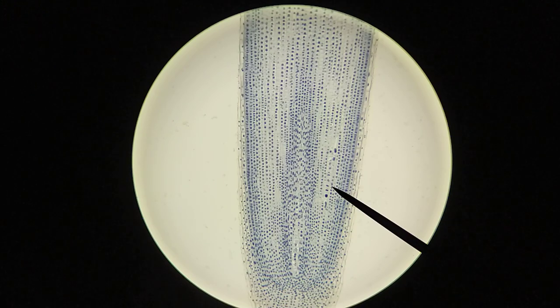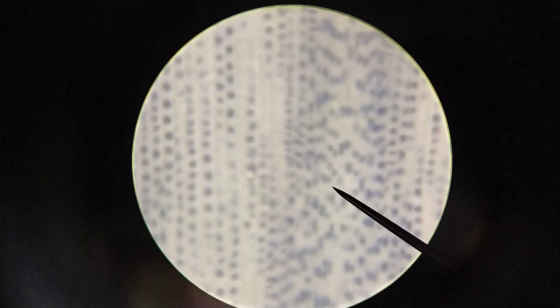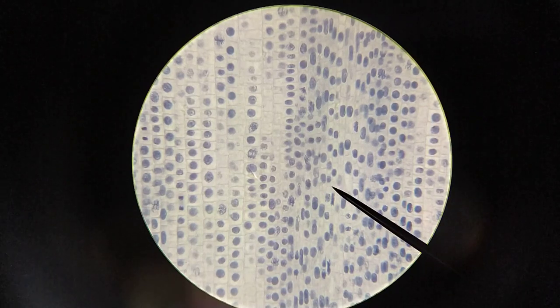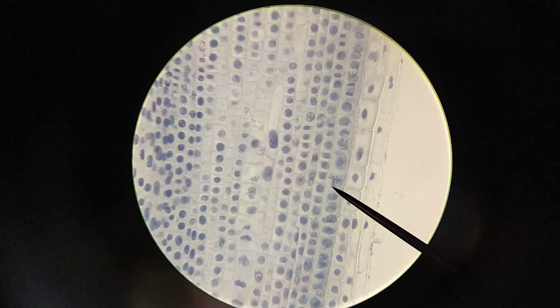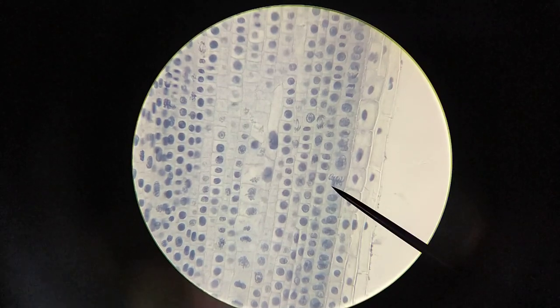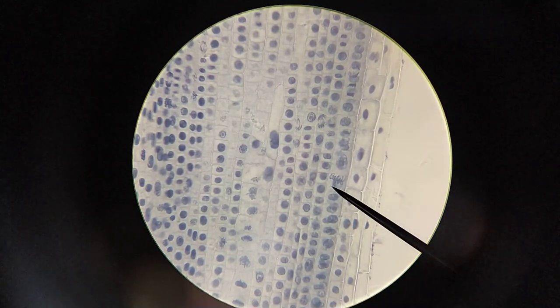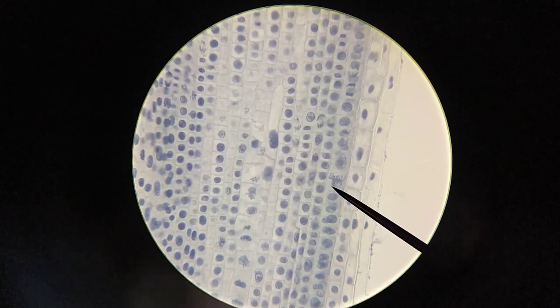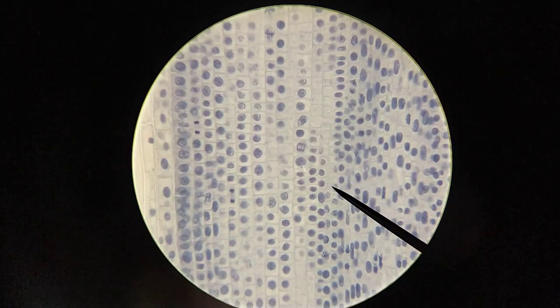Right now we're looking at the 10x objective with a 10x ocular, magnifying the slide by 100 times. We're going to switch to the 40x objective for a total magnification of 400x. Let's adjust the focus. The problem with cameras these days is they're so smart and adjust automatically, so it's as good as it's going to get.